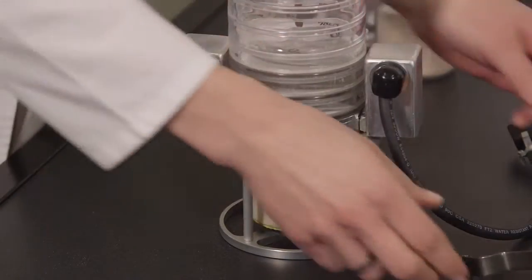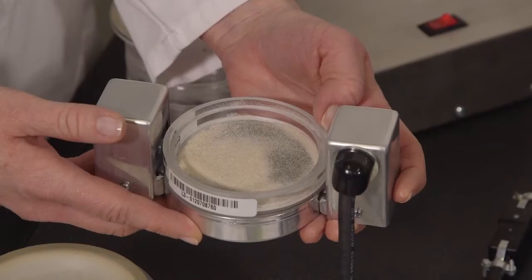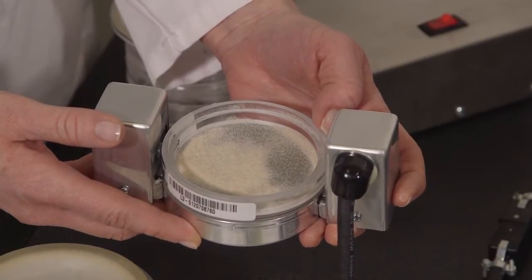This accessory is placed at the very bottom of the stack, on top of the fines collector, and will impart a horizontal tap to alternating sides of the stack.